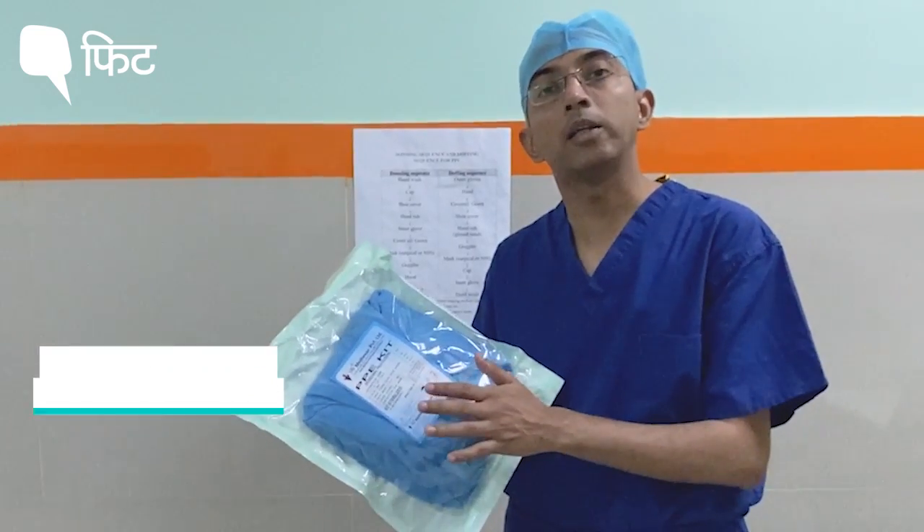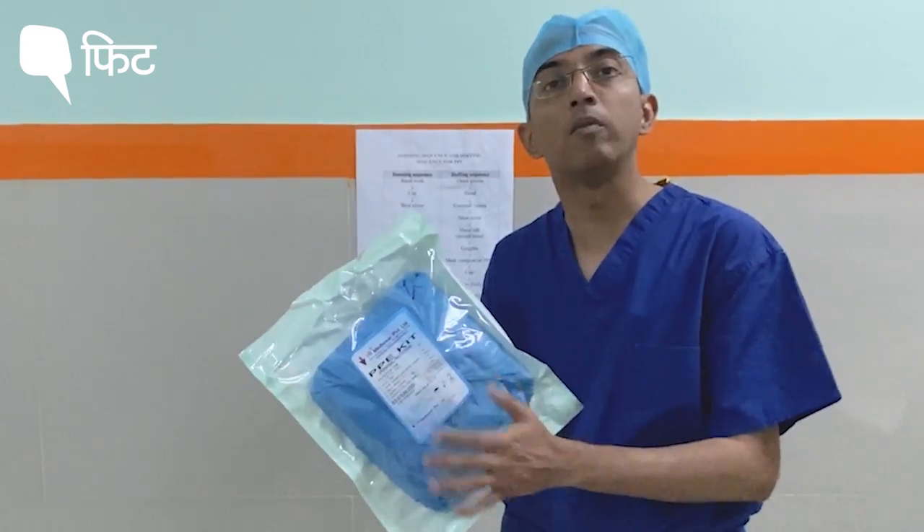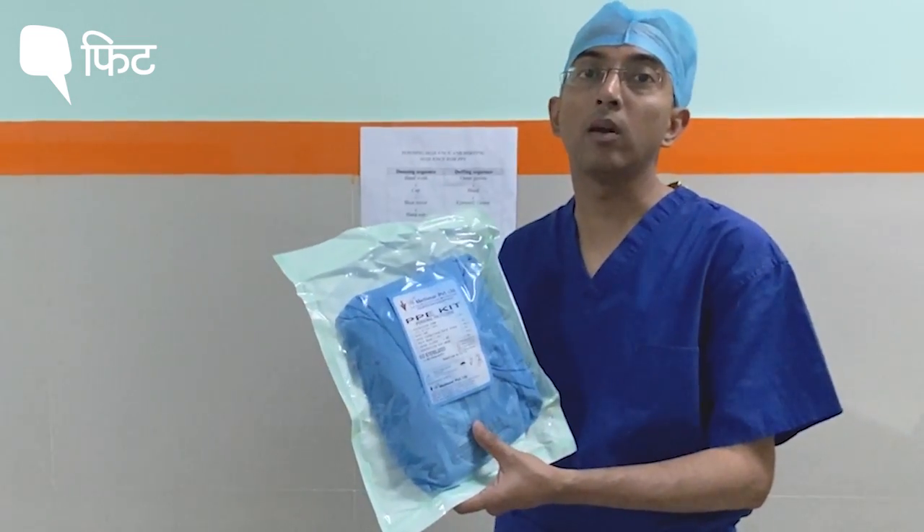This is the one with HIV and other hepatitis B and C protection kit that surgeons and OT personnel wear when operating on patients.